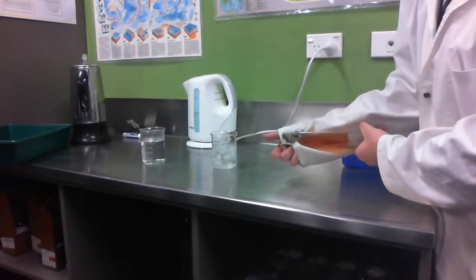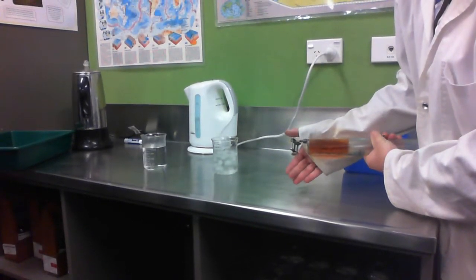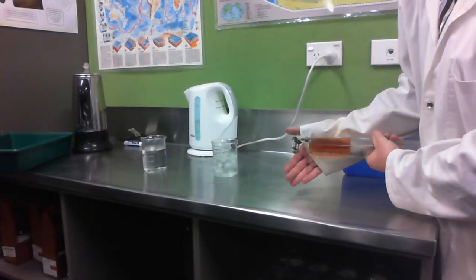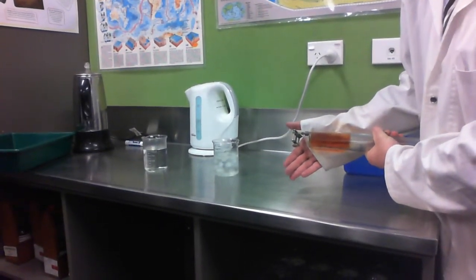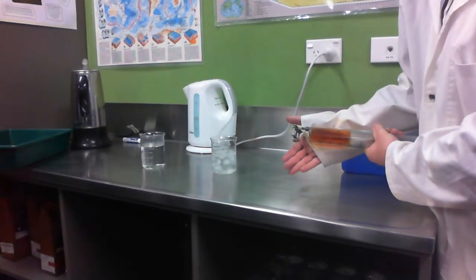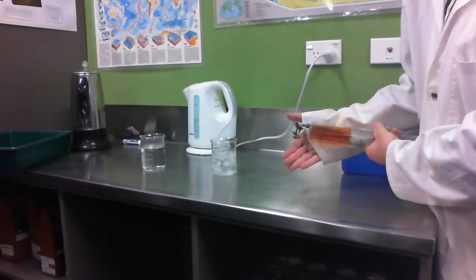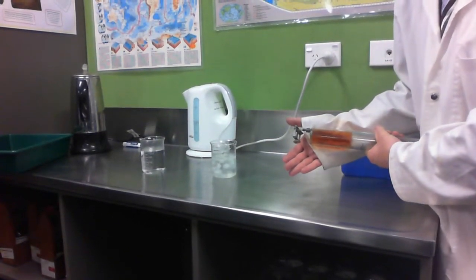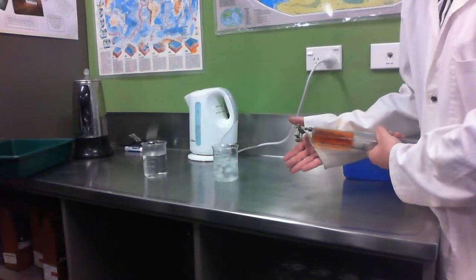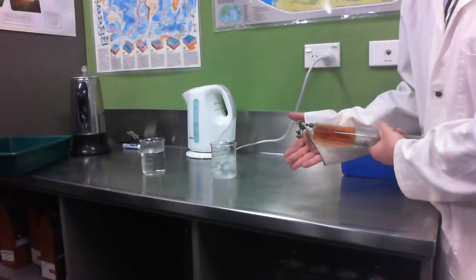So I'm going to increase the pressure. We can see it go darker because the particles are together. And then I'm not sure if it'll be easy to see on the video, but I could definitely see that it started going a little bit paler. So that tells me that if it went paler after I changed the equilibrium position, so the pressure, then the N2O4 must be colourless because more N2O4 is being made. And the NO2 is going to be our brown gas in this example.